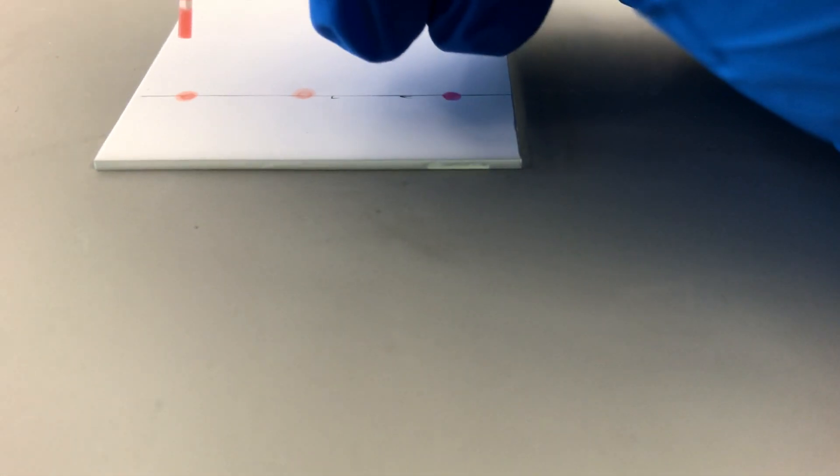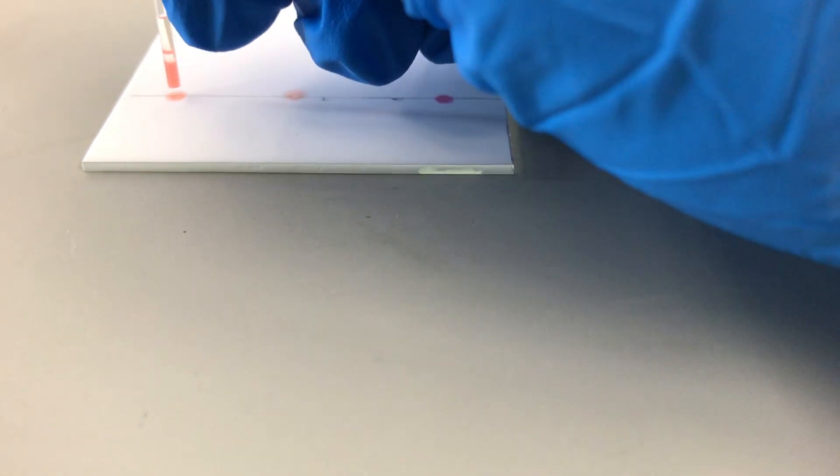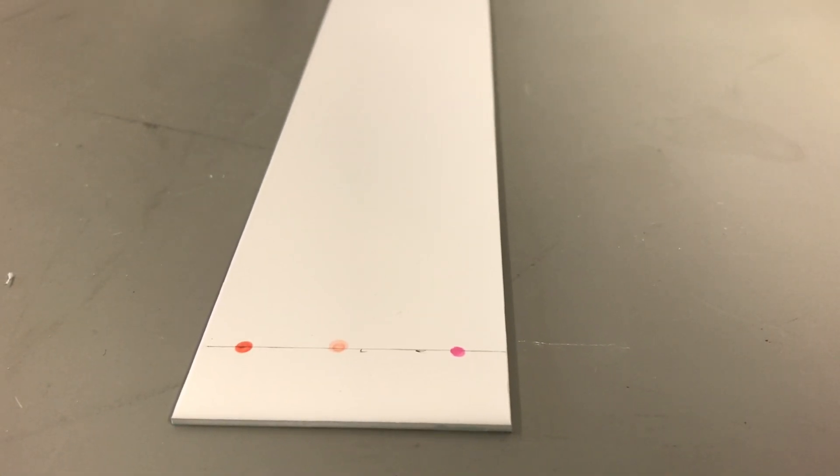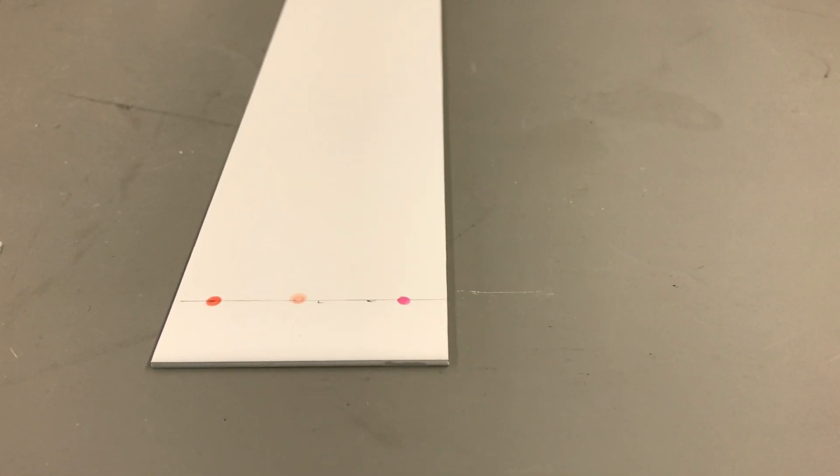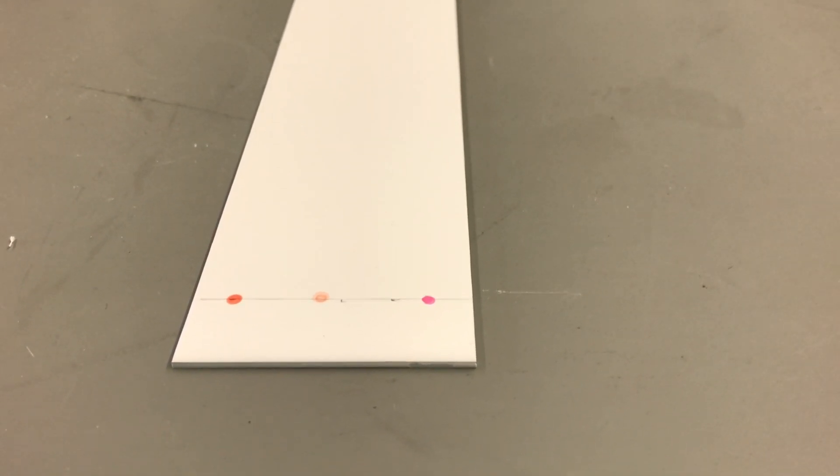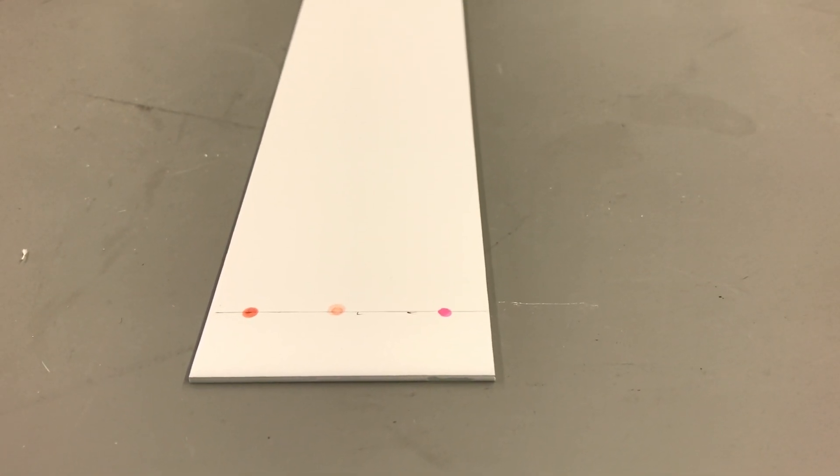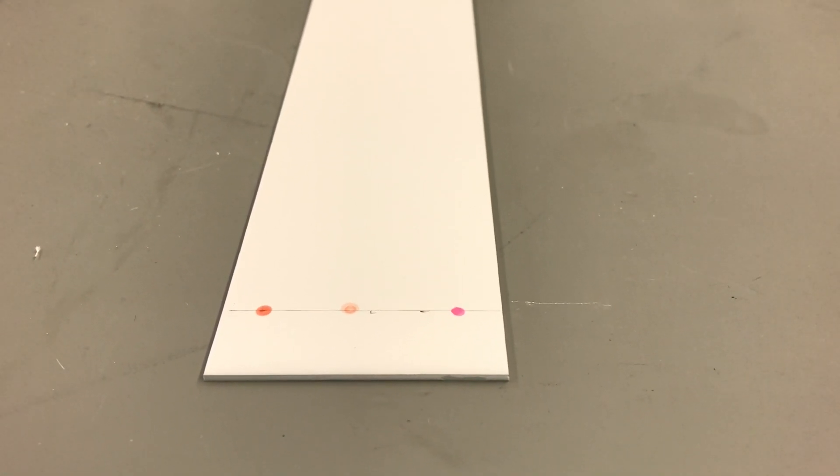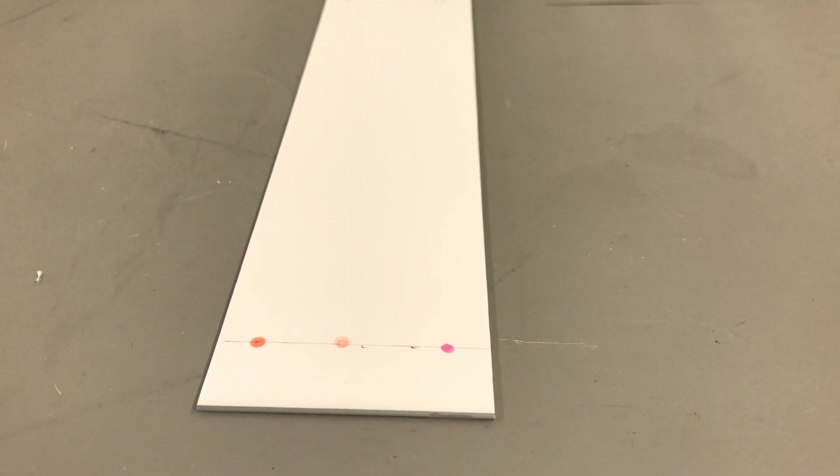At this point, the crime scene sample is probably dry, so we can apply another dot once again right in the same spot, very gently and very quickly. And do that over and over again. So we'll hit pause right now while I do the rest, and then we'll pick up once the spotting is done. Should just take a couple of minutes.